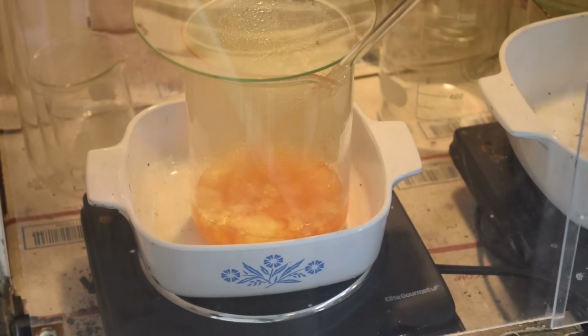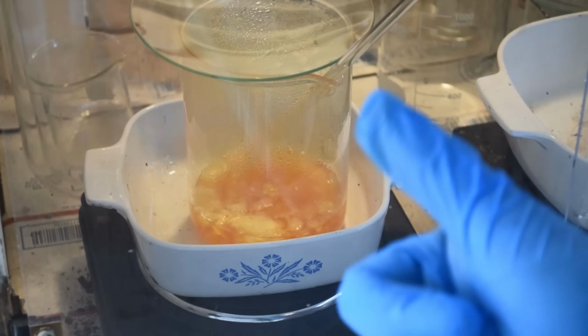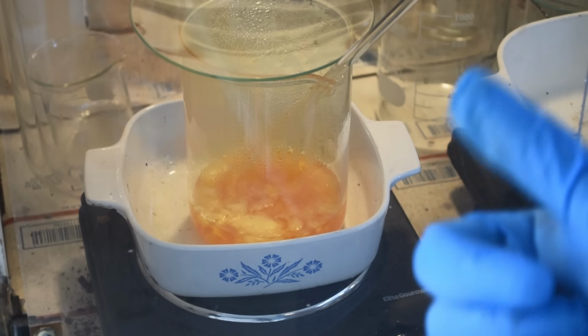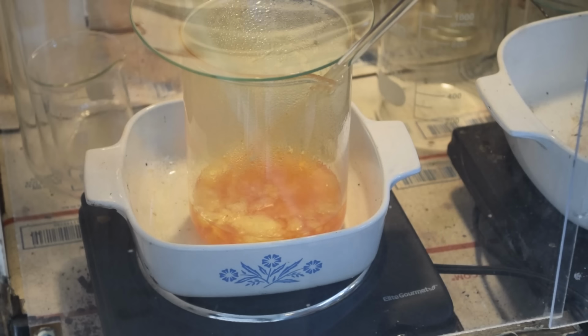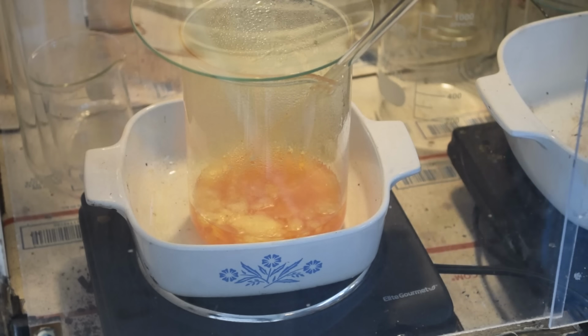Yeah. I found out where some of the gold went. It's staying in the leach solution and then precipitating out over time. And whether all of it precipitated out or not, I don't know. That's a good question. Maybe not. Am I not getting the pH high enough to precipitate out all the gold, or does it need something besides high pH to precipitate out? I don't know. So at least some of our gold is staying in the spent leach solution. That would explain a lot.